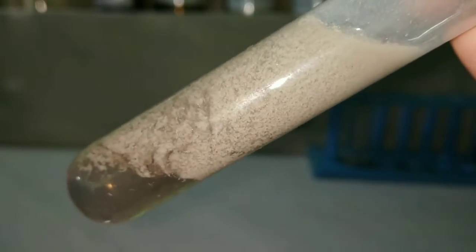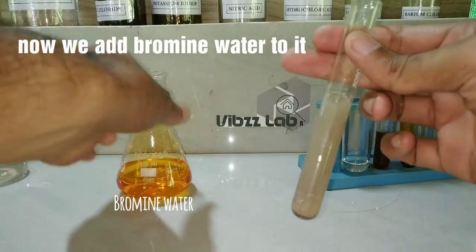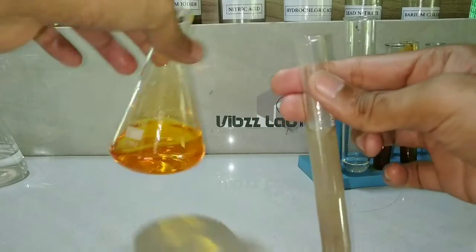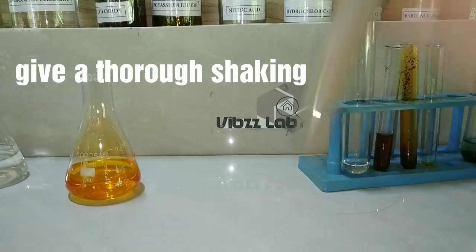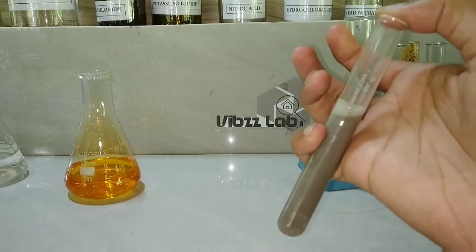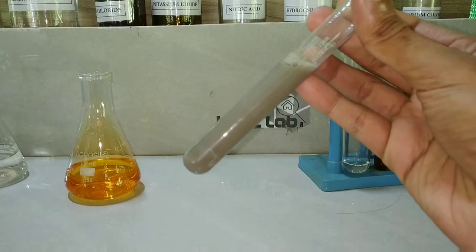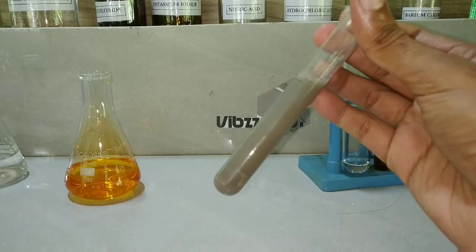We could keep this white precipitate for atmospheric oxidation to take place, but since that takes longer, we add bromine water instead. Bromine water is an oxidizing agent. On adding the bromine water, you can see a color change — the white color has turned to a darker color.